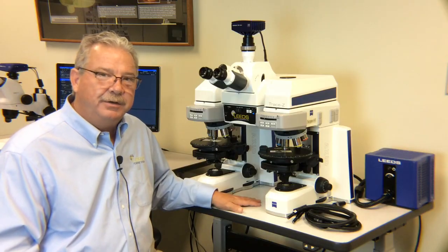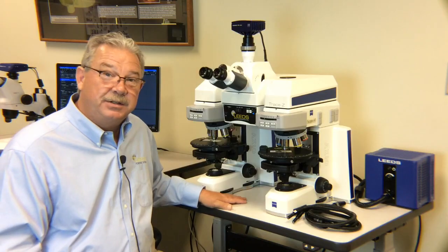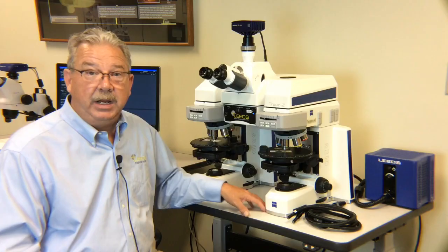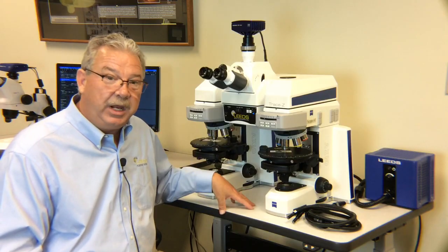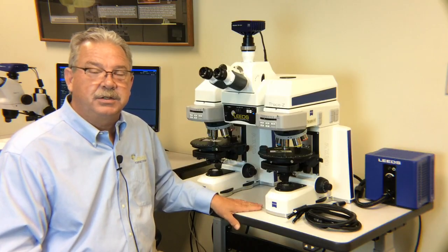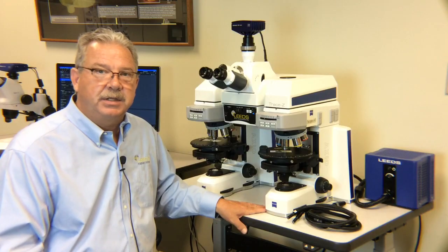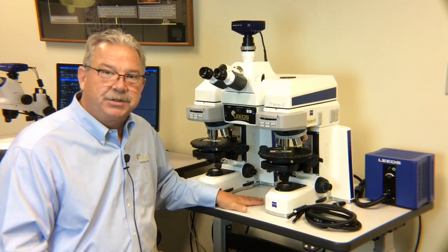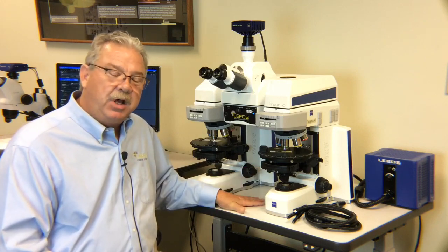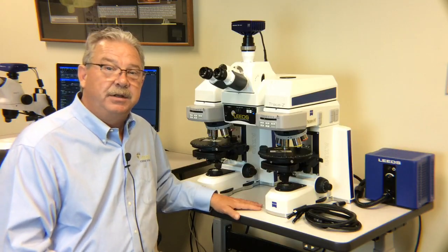Our competitors provide you a red, green, blue filter, and they suggest that you can color balance the two images yourself. Now, if we don't hand sort all the optics, you may have to color balance at each and every separate magnification while you're working with the microscope, and you can imagine how tedious that could become. Find out the microscope techniques they want, we'll build the microscope from top to bottom, you deliver it to the customer, and it's color balanced and they're ready to go.